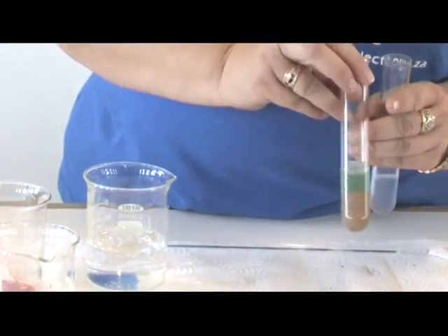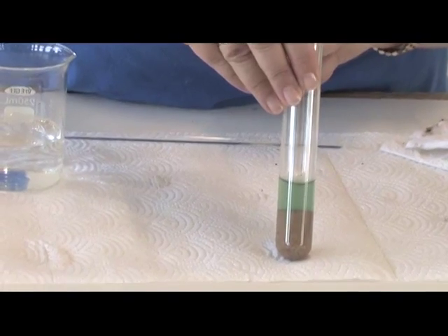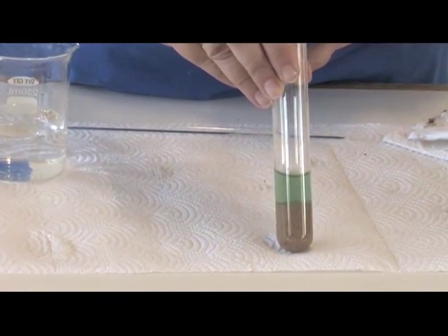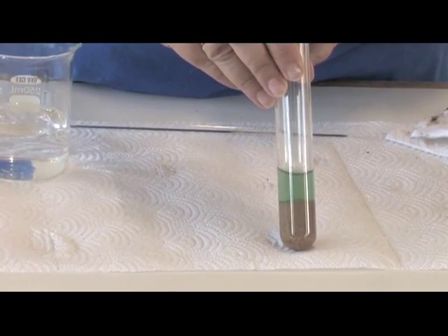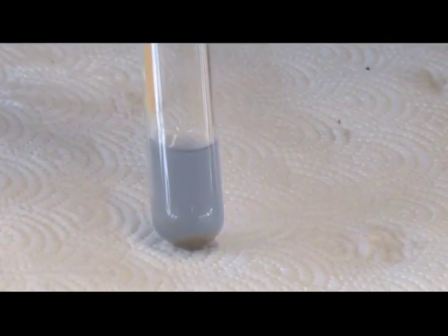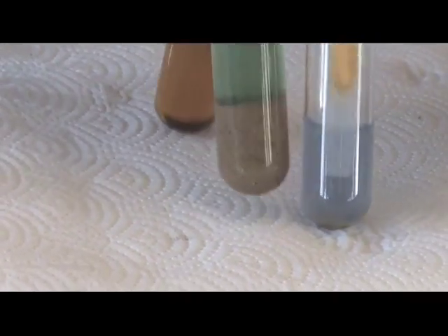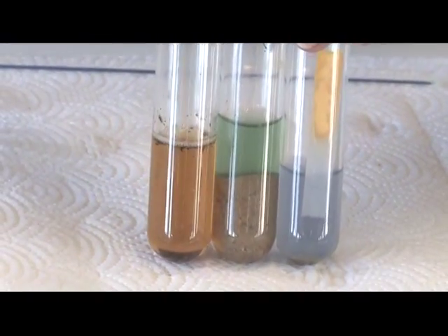You can clearly see that it's sand. The greenish color indicates a neutral to slightly alkaline solution. This gives an indication that the sand tested with universal indicator is neutral to alkaline. You can see, just for color reference, the color of a more alkaline solution — alkaline, neutral to alkaline, and acidic.